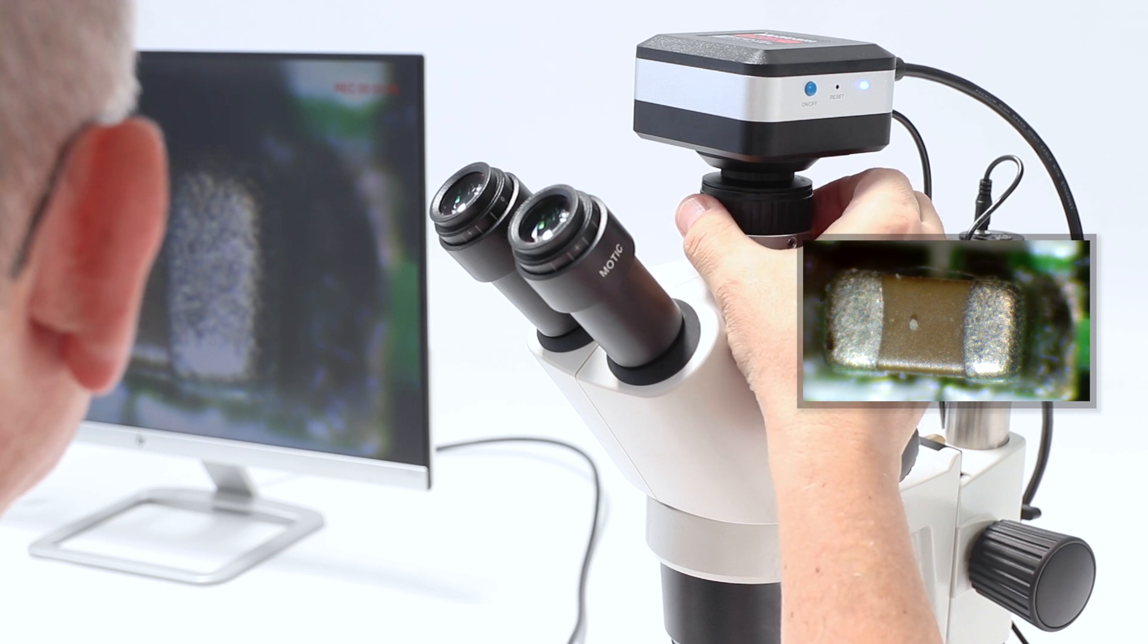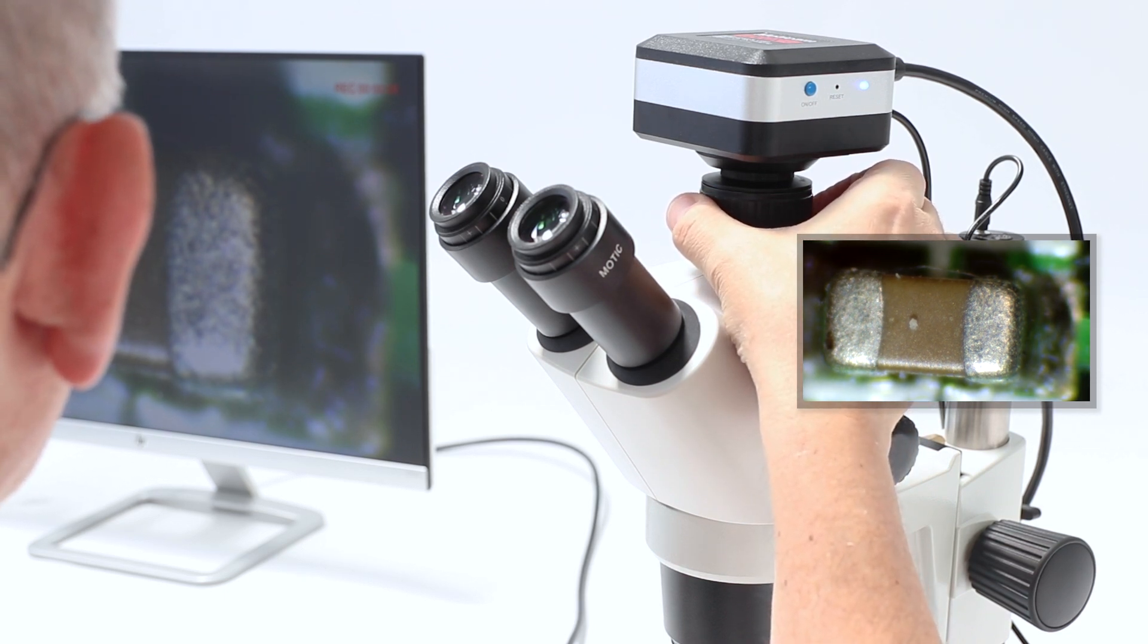Next, check the live image on your external device and adjust the focus using the adjustable ring on the C-mount adapter until the image appears sharp.